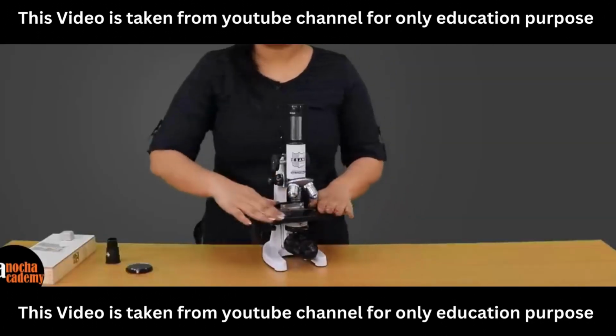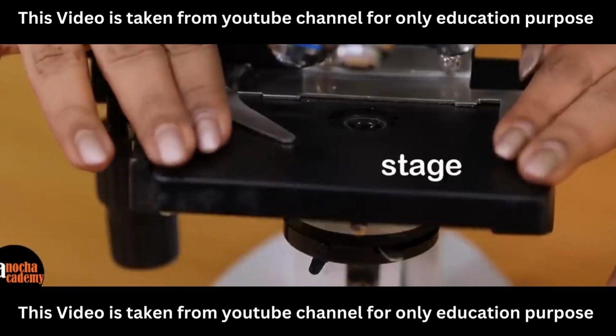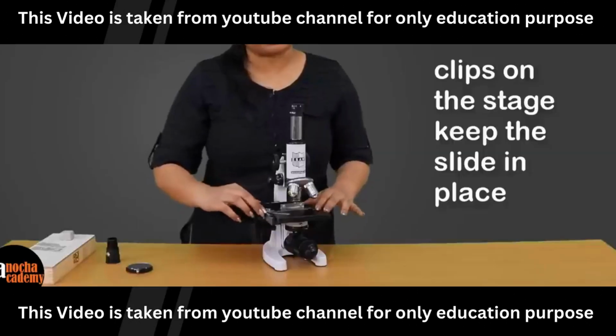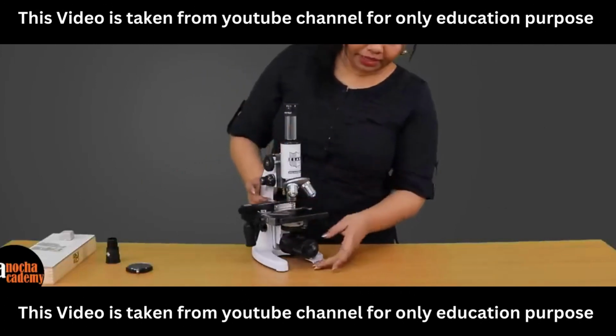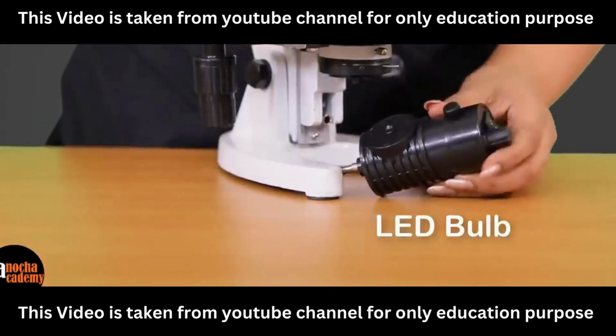Then you have this stage. This metallic stage is the base on which we will keep our specimen. And this base has been provided with clips which will help us to hold the slide in position. The source of light in this microscope is the LED bulb that we are using here.